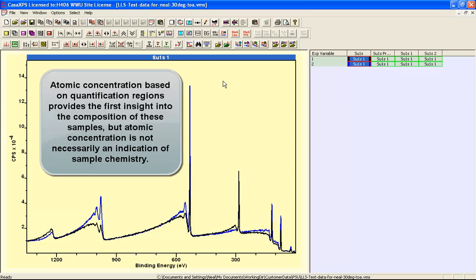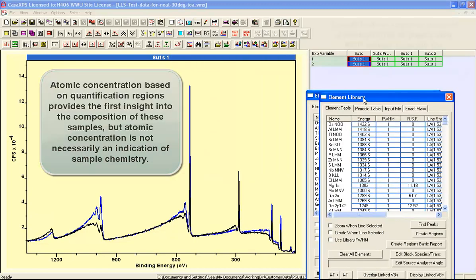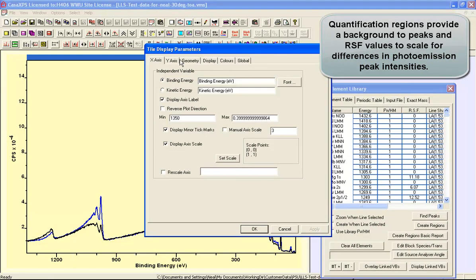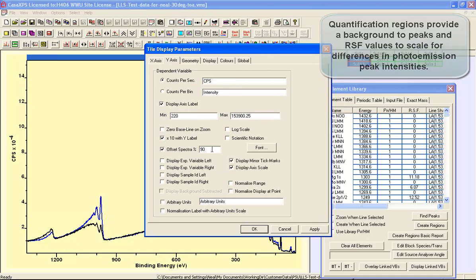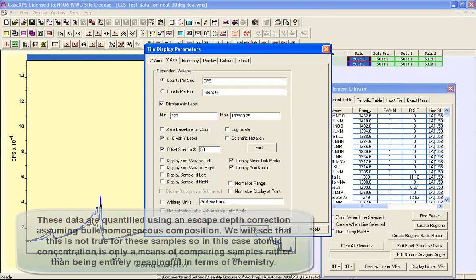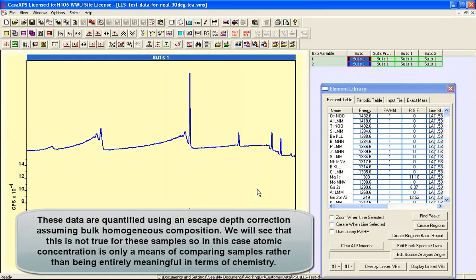To illustrate these points, we can first create quantification tables for these data. I'll also change the display mode so we offset these data, and I'll use a 50% offset in terms of the display tile so we see these two spectra stacked.